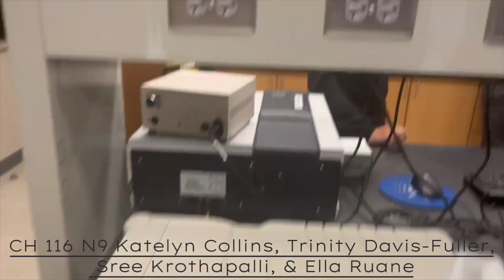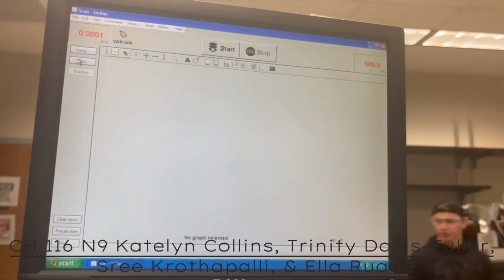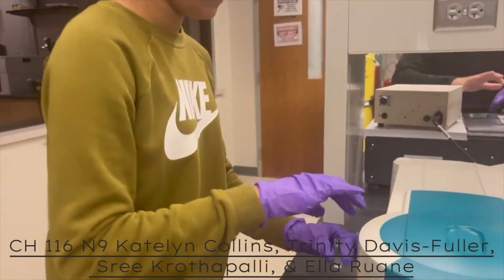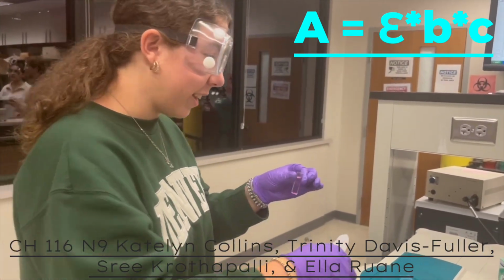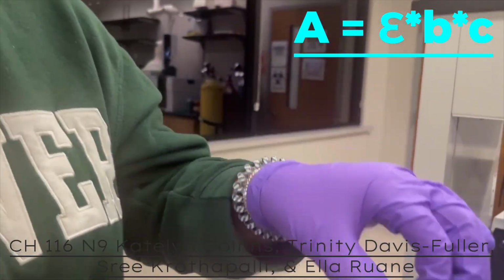Once we have collected the absorption data from the full scan, we can identify the lambda max, the wavelength where the solution absorbs the maximum amount of light, the highest peak on an absorbance versus wavelength graph. We can connect all of this to the Beer-Lambert law as shown. A is the absorbance value measured by the spectrophotometer. This value is read directly from the machine.